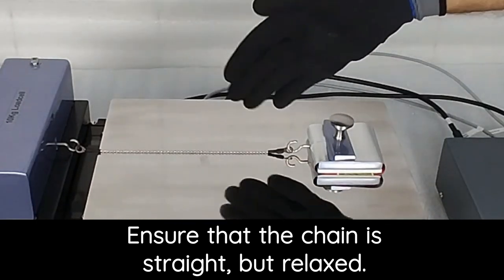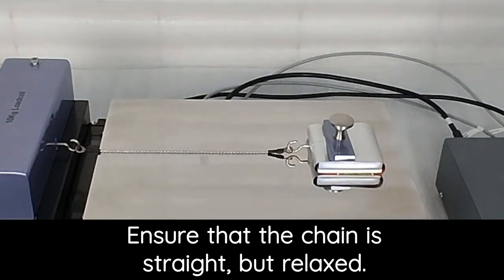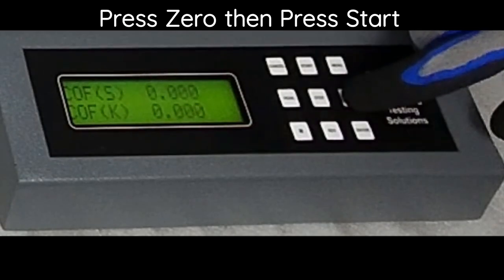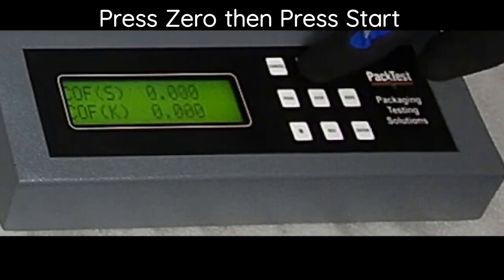Ensure that the chain is straight but relaxed. Press 0, then press start.